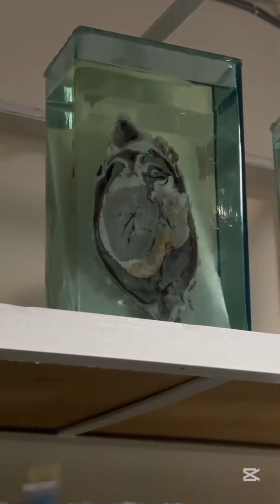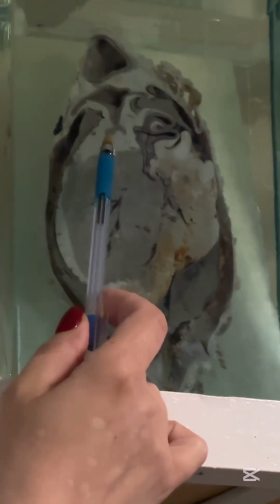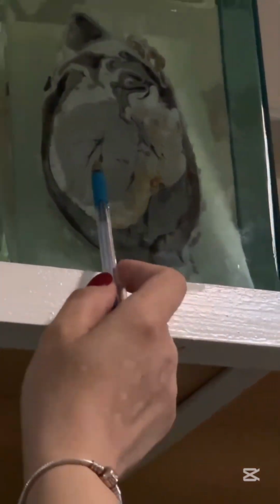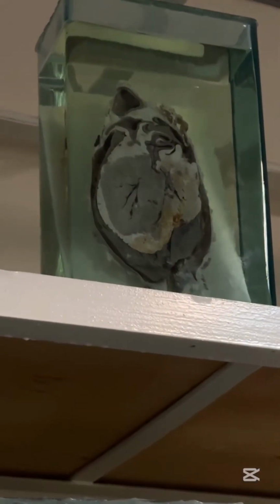That is longitudinal section through heart. That is left ventricle, blood in cavity of pericardium, tamponade. What happens? First of all, thrombosis of coronary artery. You see brown thrombus inside of coronary artery. That's why myocardial infarction. It should be transmural infarction. That means infarction in all layers of heart.